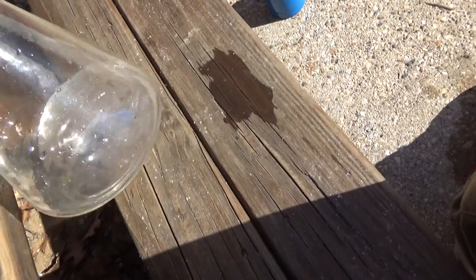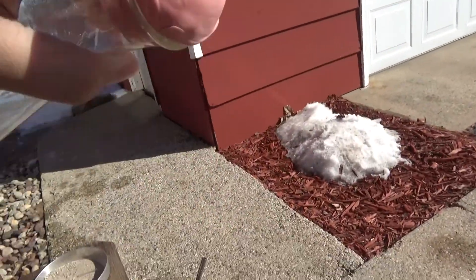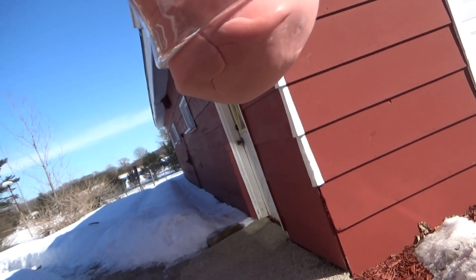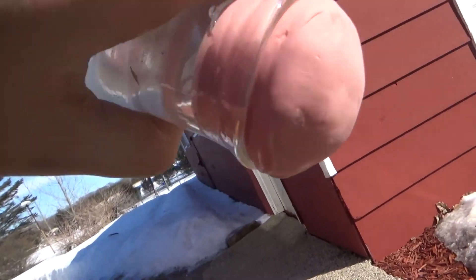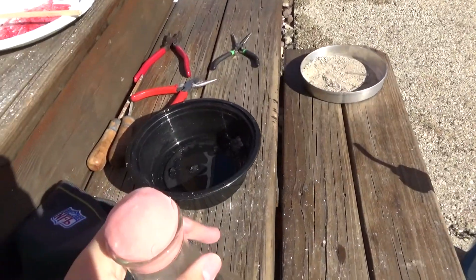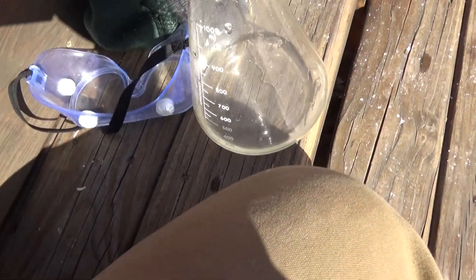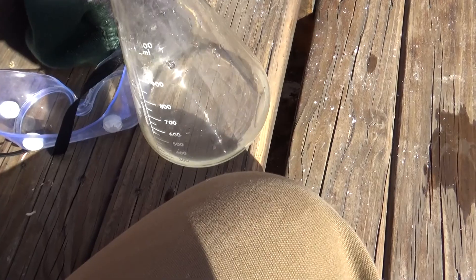I'll tip it over and see what happens. And there you go — works pretty well. Looks like the water isn't even seeping down any further; there are no leaks. So if you want a simple, cheap, and perfect-size stopper for your flasks, this should work very well.